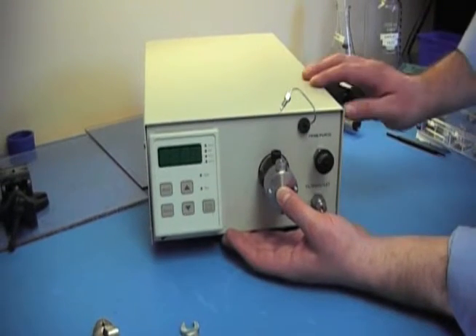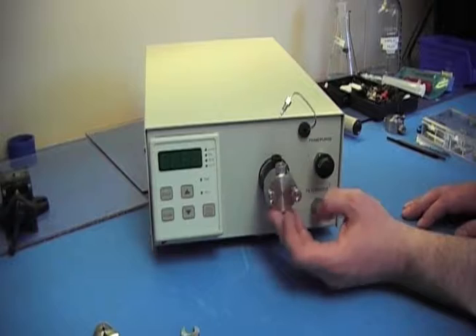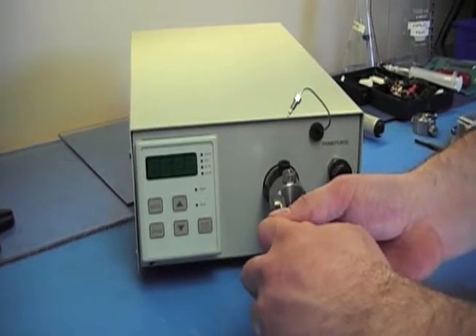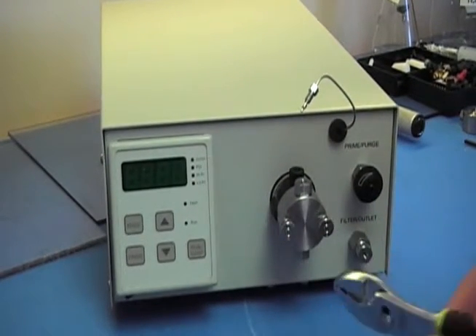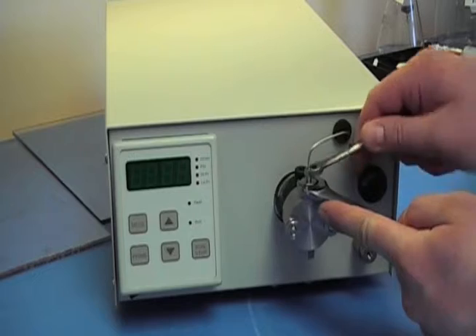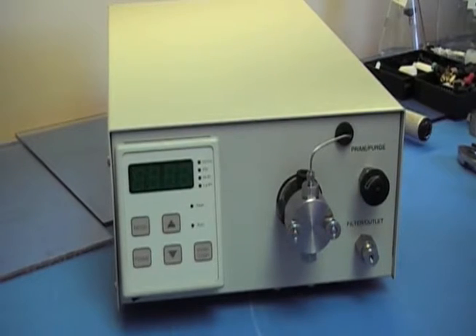Put your thumb in the middle and press down. Grab your thumb nuts and tighten them down finger tight, then grab your pair of pliers and turn them about an extra quarter of a turn. Hook up any lines that you might have disconnected, and your head is successfully reinstalled.